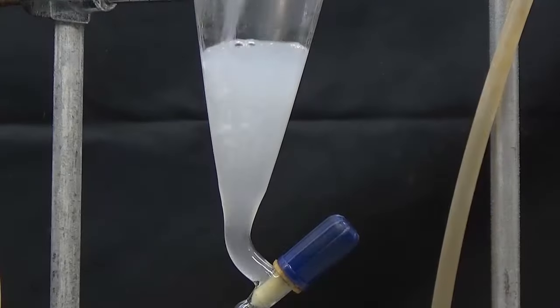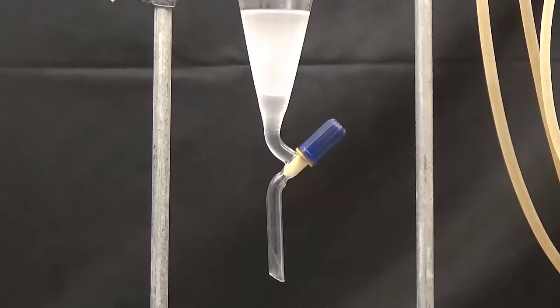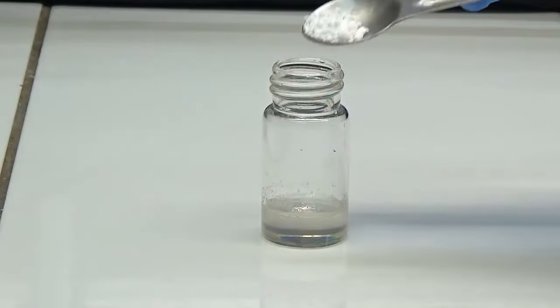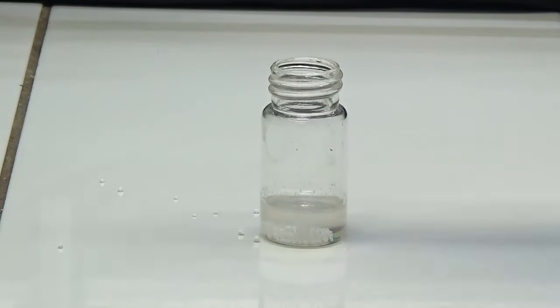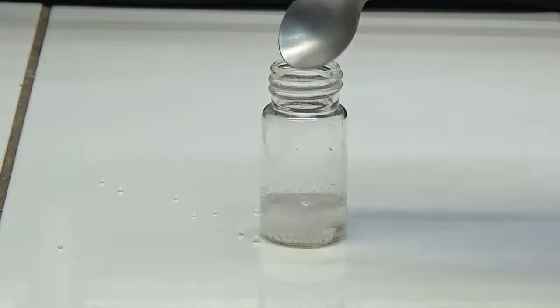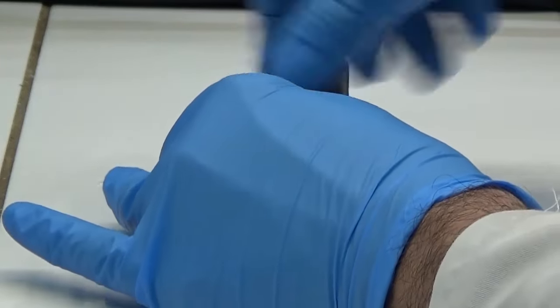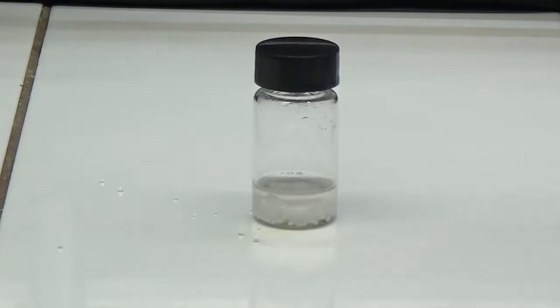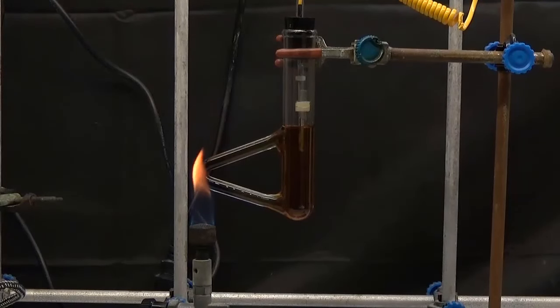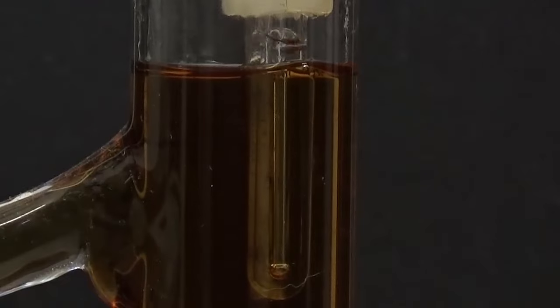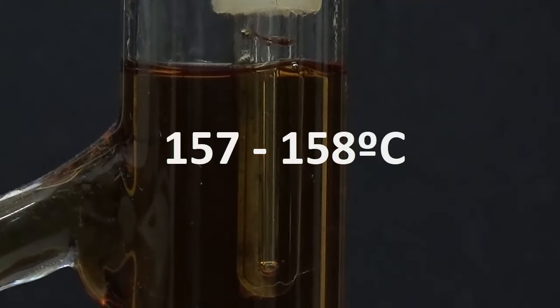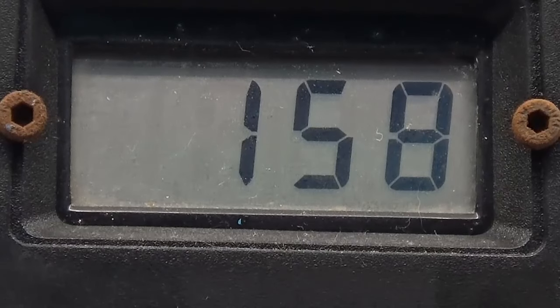The oil was decanted in a funnel and dried with anhydrous calcium chloride. We calculate the boiling point of the resulting material. In our test, a boiling point of 157 to 158 degrees Celsius was determined, and the theoretical boiling point for 2-furan methanethiol was 155 degrees.